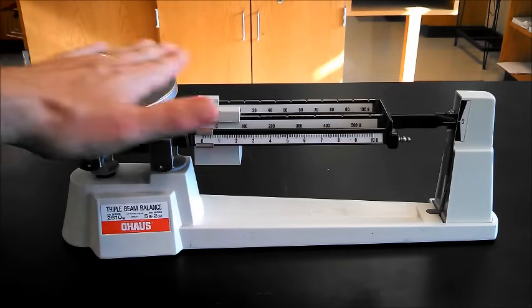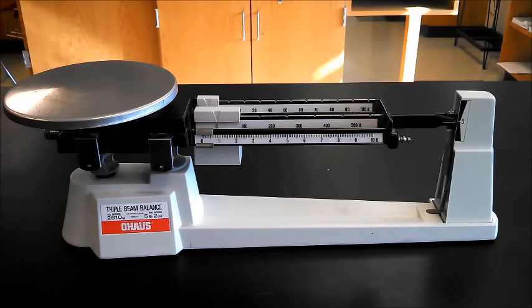Here is the pan. We want to make sure the pan is clean and free of any debris or water that might be on it before we start. If we don't, that could affect our results. We would be taking the mass of the water or whatever is on there instead of the mass of just our cube.